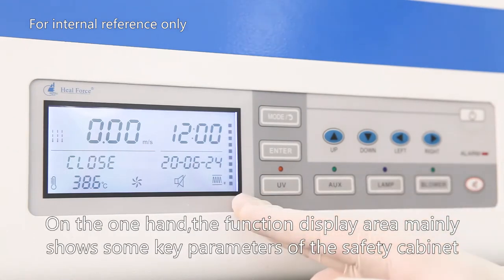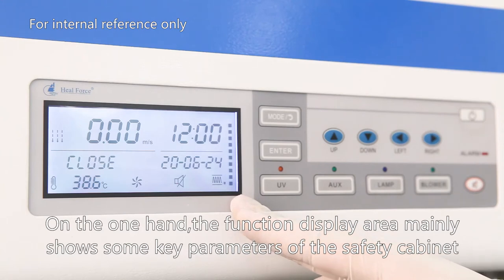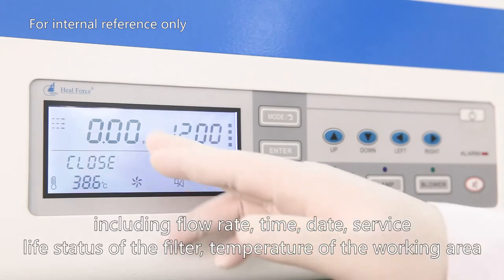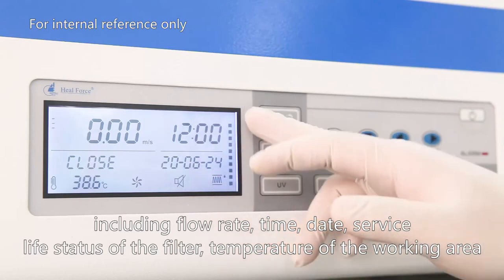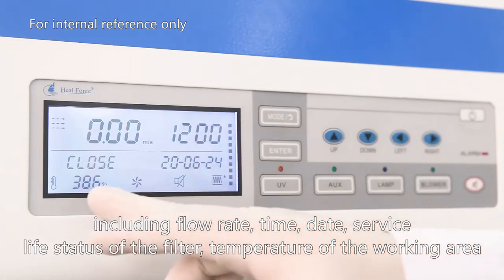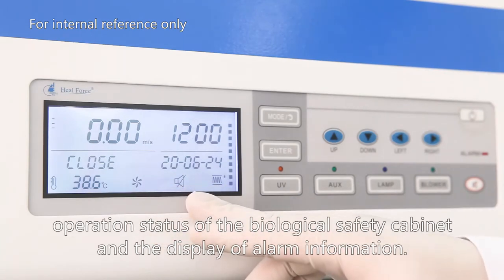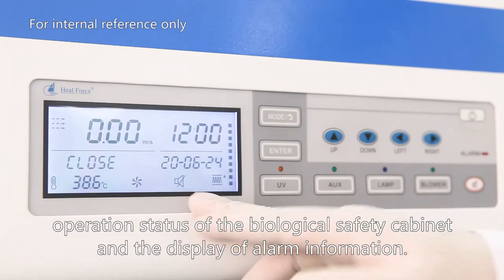The function display area mainly shows some key parameters of the safety cabinet, including flow rate, time, date, service life status of the filter, temperature of the working area, operation status of the biosafety cabinet, and the display of alarm information.